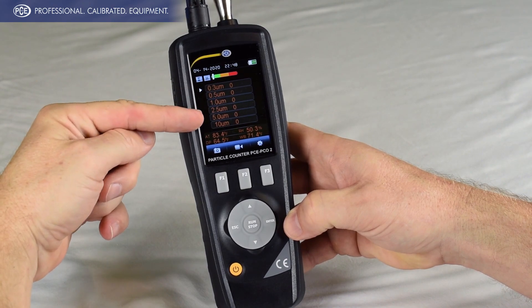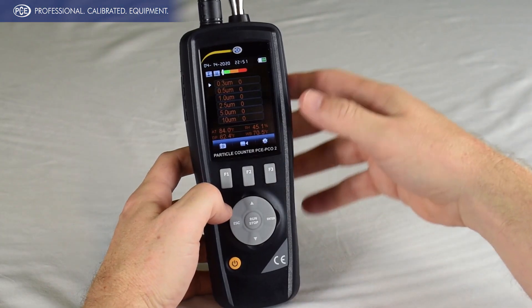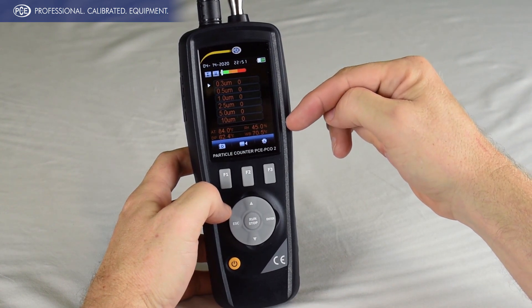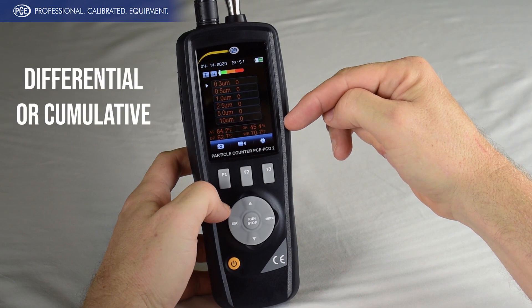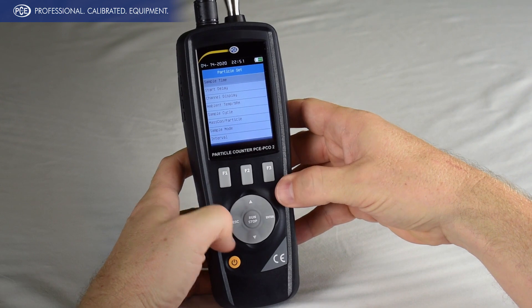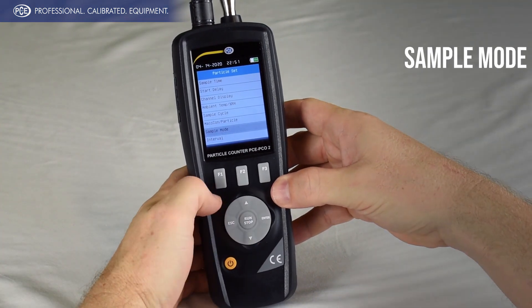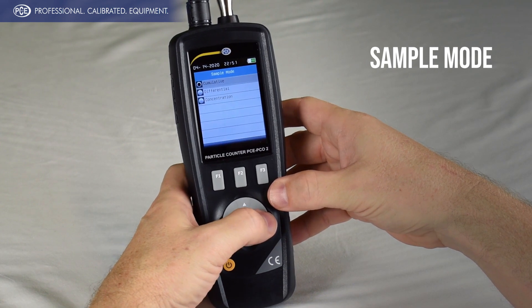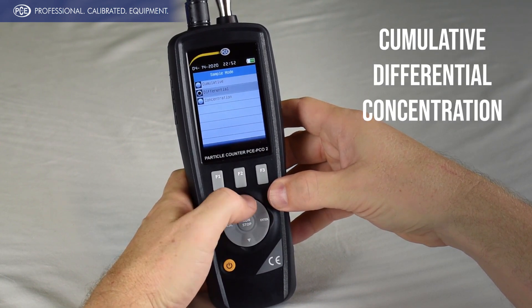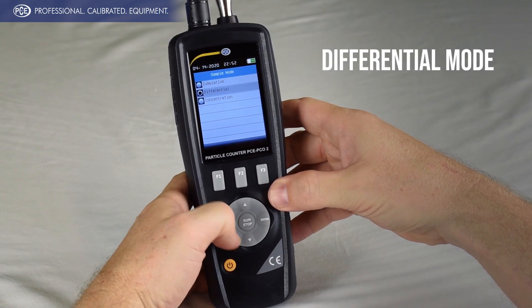Now you have all six of your channels displayed. The next thing to decide, since we chose a straight particle count, is that the mode can be either differential or cumulative. To make those selections, go back into the settings menu and scroll down to sample mode. You can do cumulative, differential, or concentration. For the first one we'll do differential mode — hit escape to save.